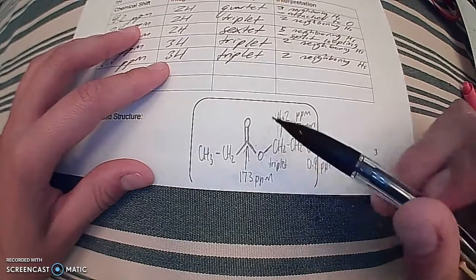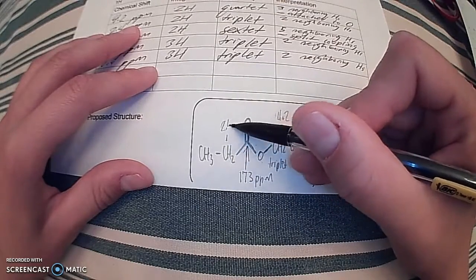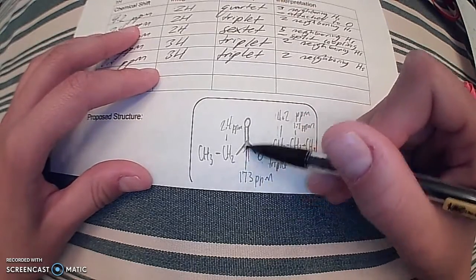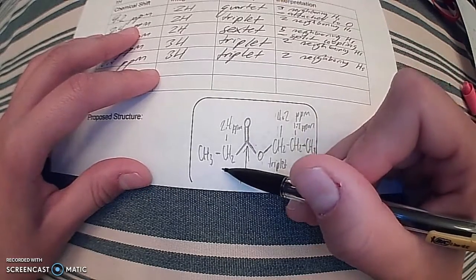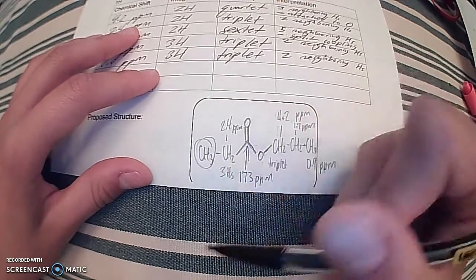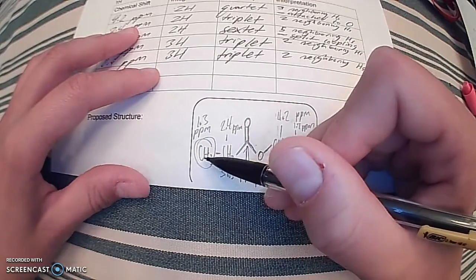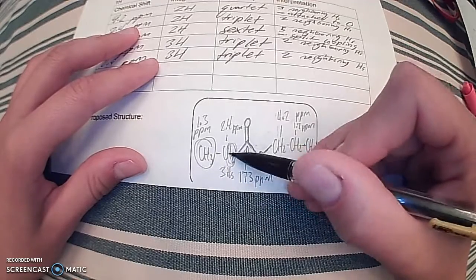So coming over to this CH2 group over here, this is a 2.4 parts per million. It is still kind of high because even though it's not attached to an oxygen, it is nearby the carbonyl. So we have 2.4 parts per million, and this one is a quartet, meaning that there are 3 hydrogens nearby, which makes sense if we look to the left. There's our 3 hydrogens with our last and final methyl group coming in at 1.3 parts per million. And this one is a triplet, indicating there are 2 hydrogens nearby, which is these 2 right here.